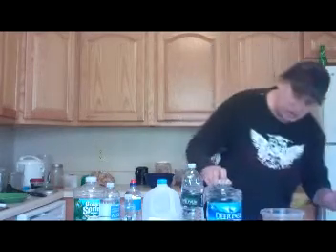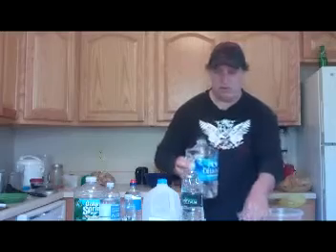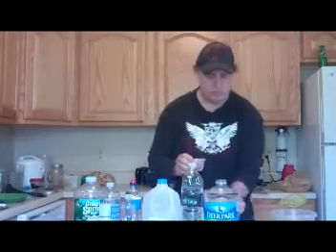So what we'll do is we'll start with Deer Park. Everybody loves Deer Park, right? But we'll see — Deer Park is probably not as great as everyone advertises. So take a drop — we have to fill this up.